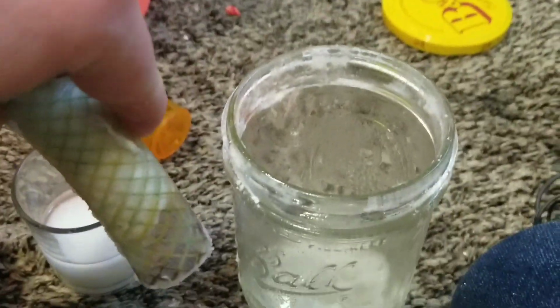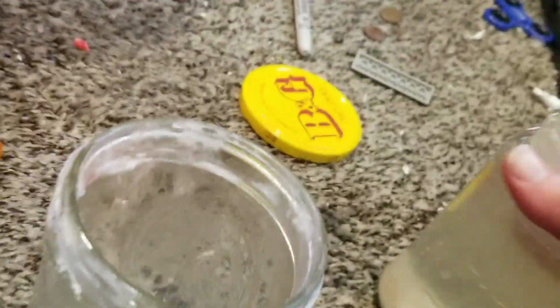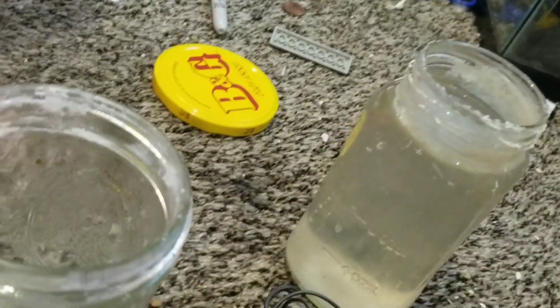But did it fully work? Did it work as much as I really wanted it to work? So as you can see, all of the really heavy crystals fell to the bottom of the container. They broke off of this thing because it was vertically inclined or whatever. I don't know the proper term for it. At the bottom of this calcium acetate solution, there was also cloudy stuff. On this side, the membrane grew crystals, but on this side, it just grew powder. So, yeah.